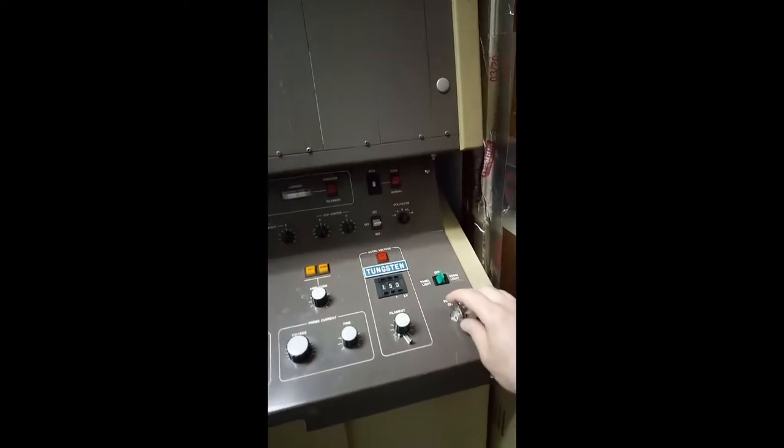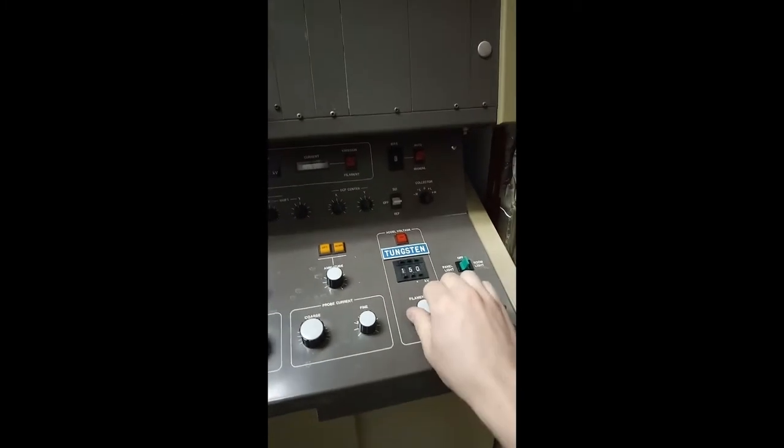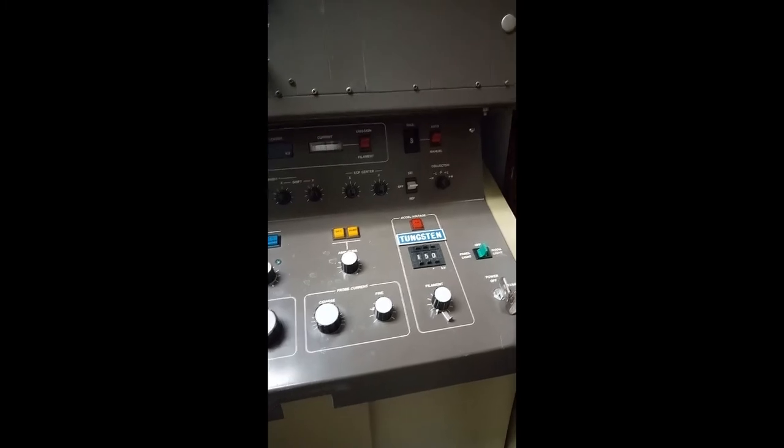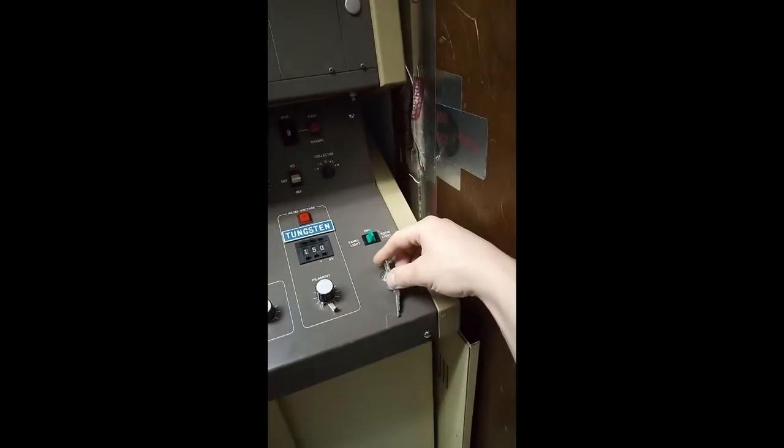Finally, we make sure the acceleration voltage is off and the filament knob is turned all the way counter-clockwise. And we start it up.